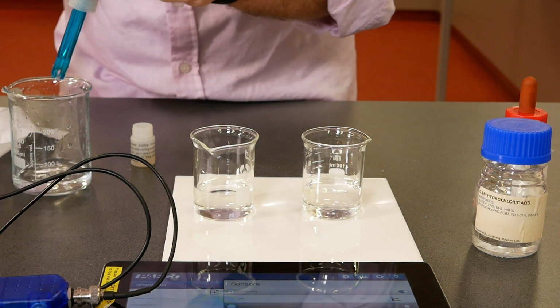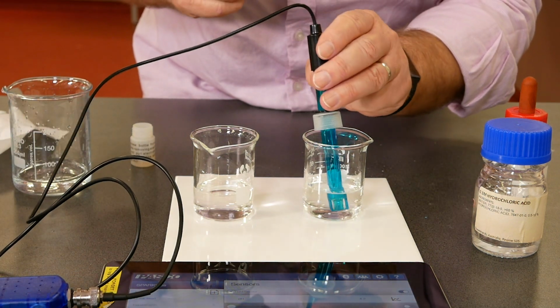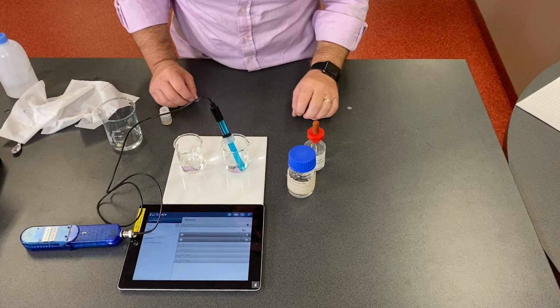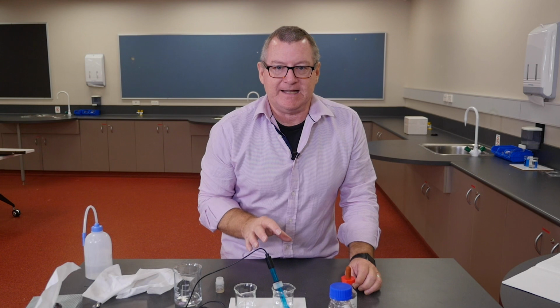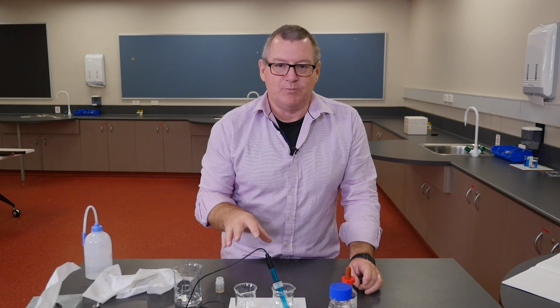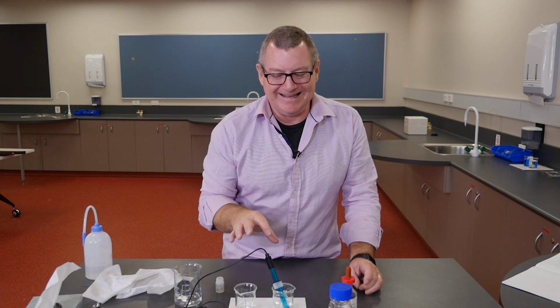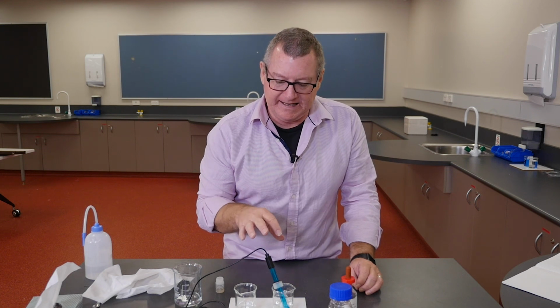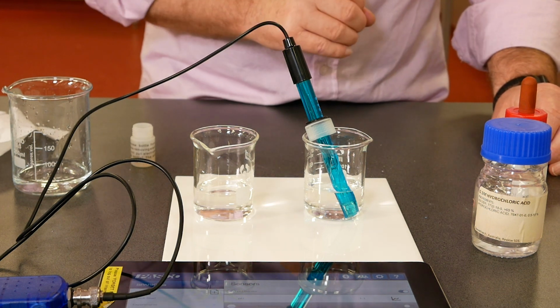Give it a quick wipe down with a new tissue and pop it into the hydrochloric acid, and it's equilibrating down at about 1.4, 1.3, a pH of about 1.3 compared to the 3.2 of the acetic acid. So you can see that even at the same concentration, the hydrochloric acid, being a strong acid, is much more acidic. It has a much lower pH number, therefore is a much more potent acid. I'm trying to avoid the words both strong and concentrated, but it is more acidic. And in fact, after sitting for a moment, it's gone down to 1.1 pH, which is a quite low pH.